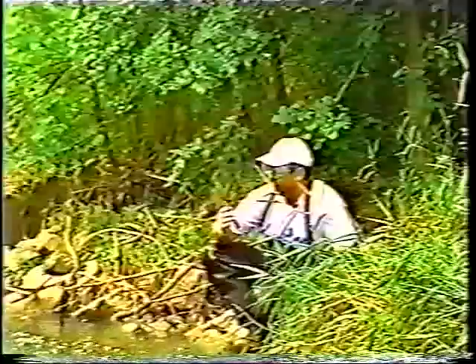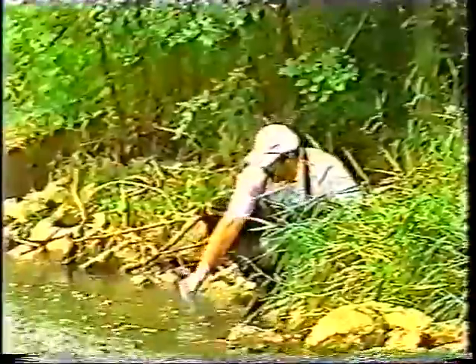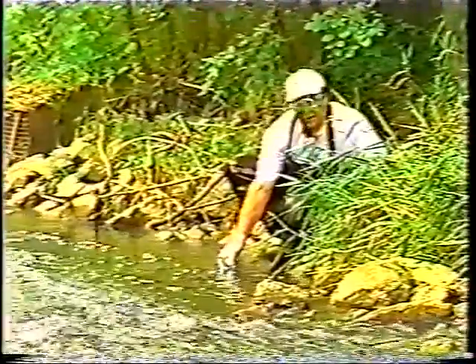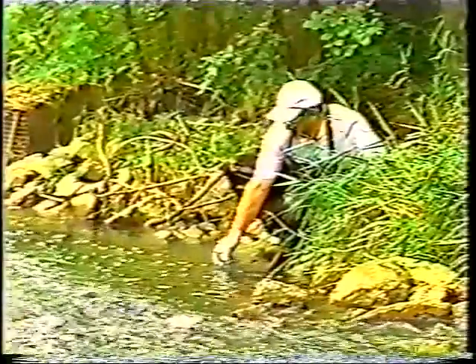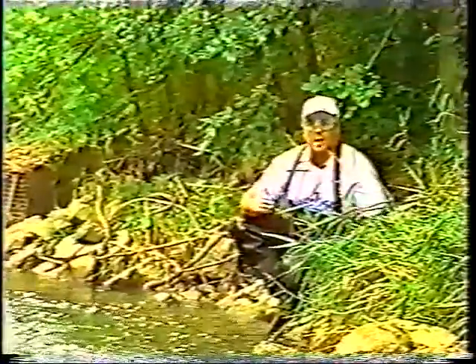I take it out, put it back into my case, make sure it adjusts back to 7.0 like it just did. And then I go ahead and I take the pH again in the same spot. Let it adjust. And again, it's 7.2 after I let it stabilize. I'm going to do this one more time at this location.